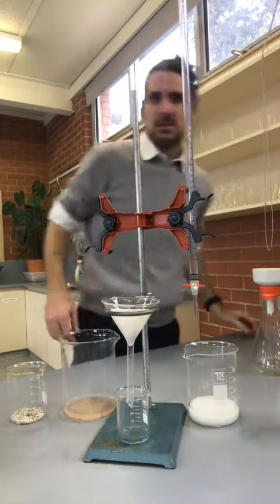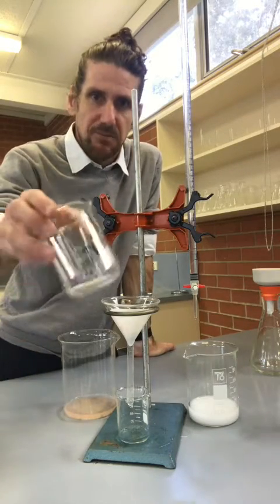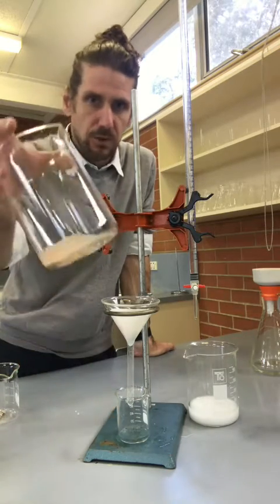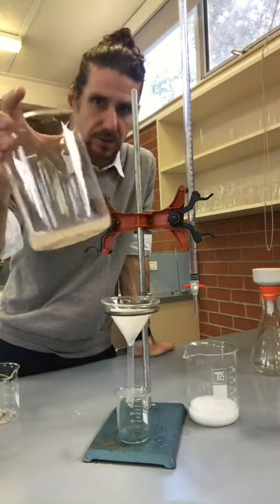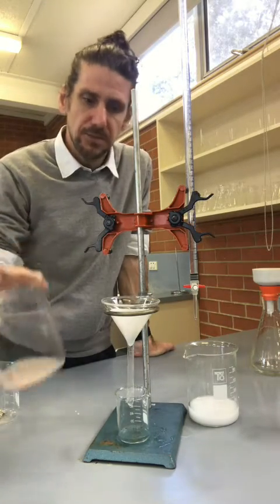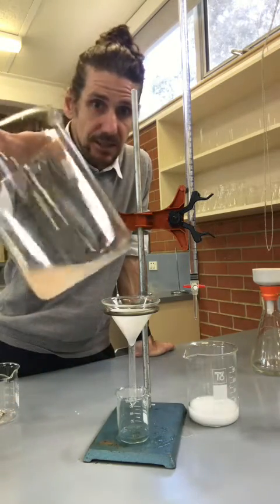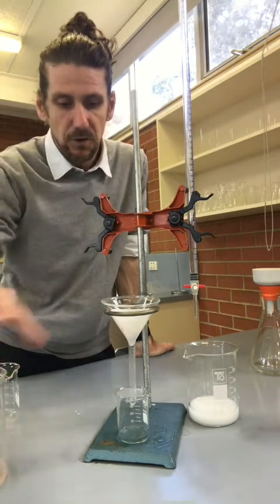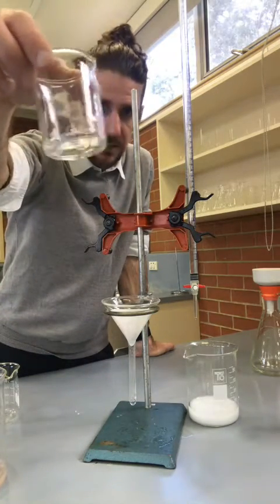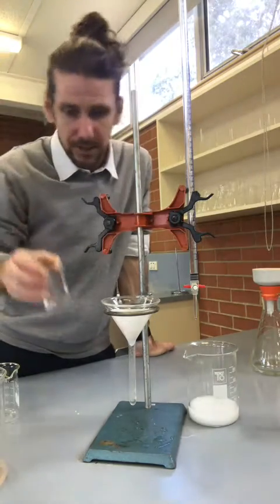To find that out, we need to take sulfate on a journey into a precipitate. We start off by getting some of the fertilizer and dissolving it in water, which makes this grainy little substance here. All the sulfate in the fertilizer dissolves, and then we can filter out all the solids, so in our filtrate there are just sulfate ions — plus probably some other dissolved ions, but sulfate is the main one.